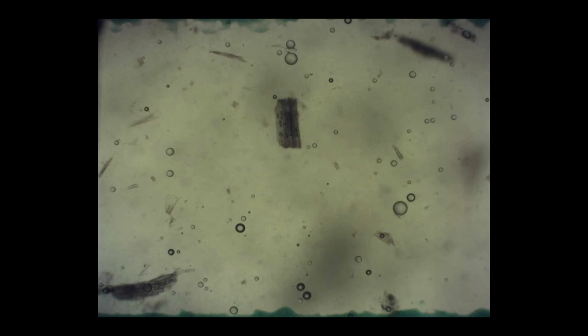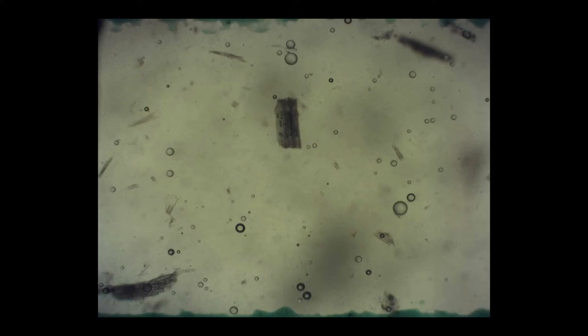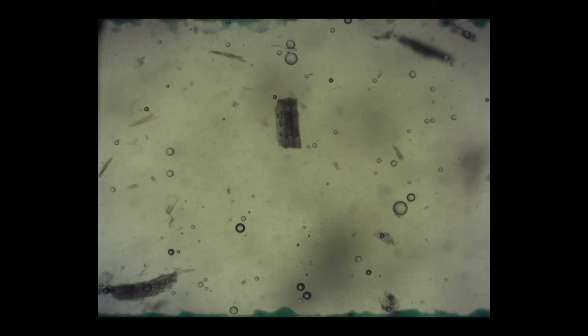Something that's not discussed often is the amount of distracting things that are in a sample when you look under the microscope. In this field of view, there are no nematode eggs. The perfectly round, empty circles are air bubbles and there can be a lot of them. There are also a lot of pieces of partially digested plant material, which can be pretty distracting as well.